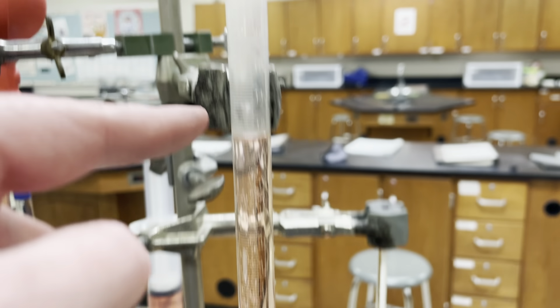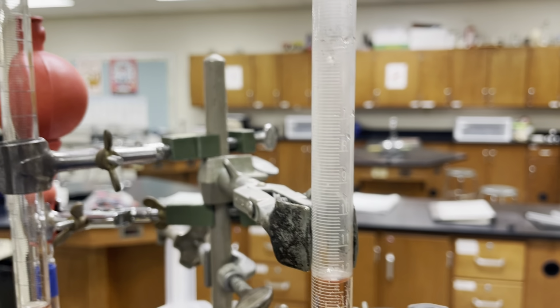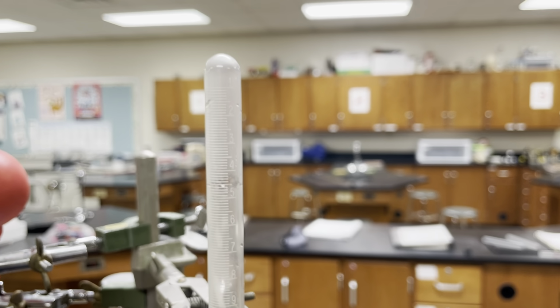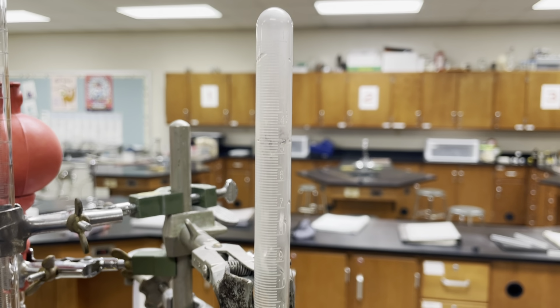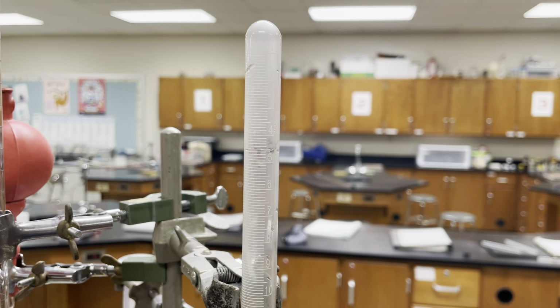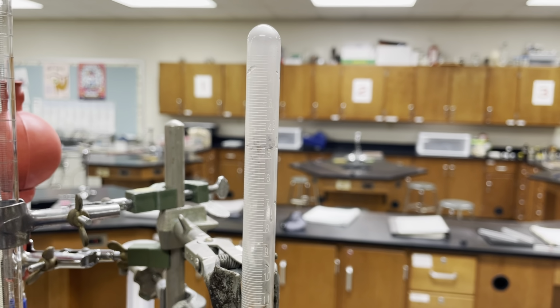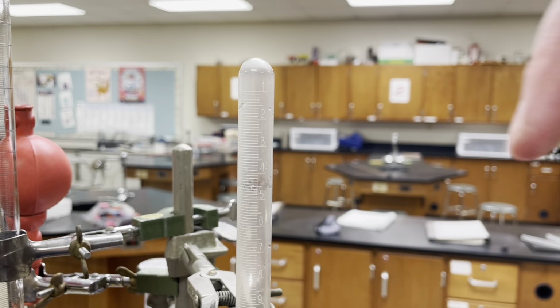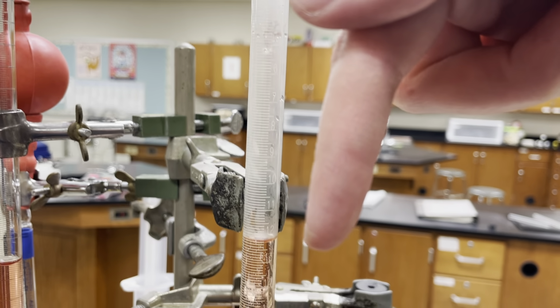So in some cases we have numbers read downwards because it helps us figure out how much liquid is going to be dispensed. In this case, it just fits the sense of measurement better. The reason we're measuring this is because we want to figure out how much gas is in here, and it makes more sense to do that downwards. If we collect more gas, it's going to increase our measurement going down this way.